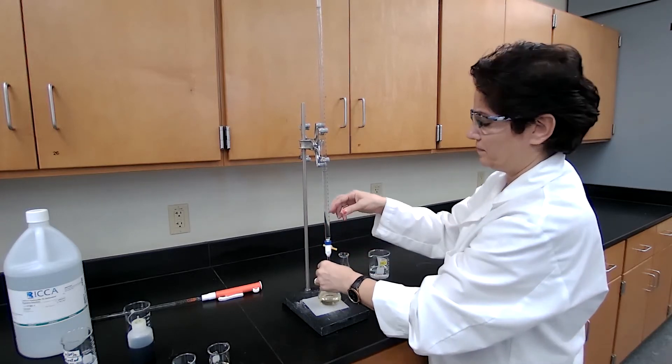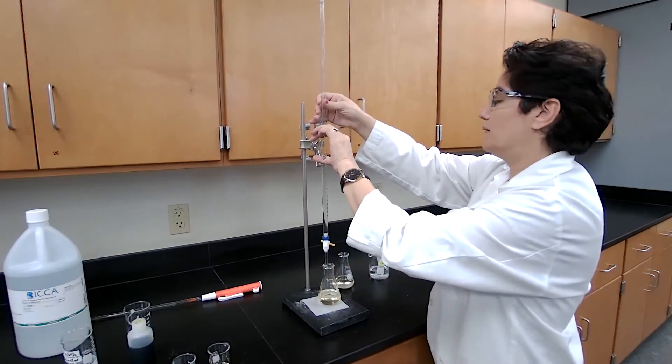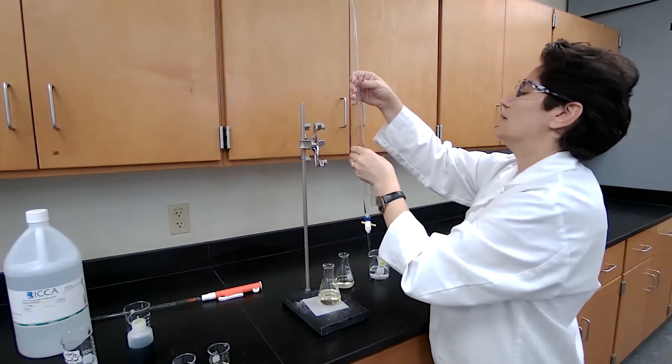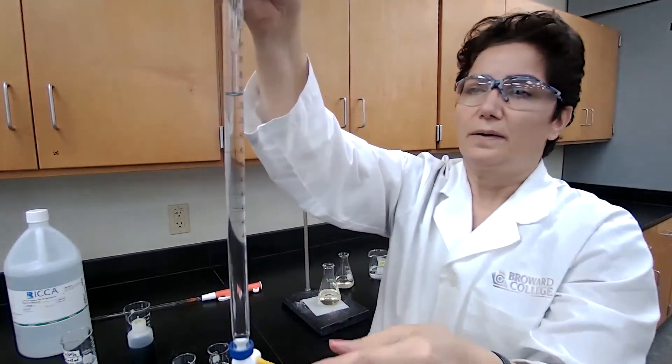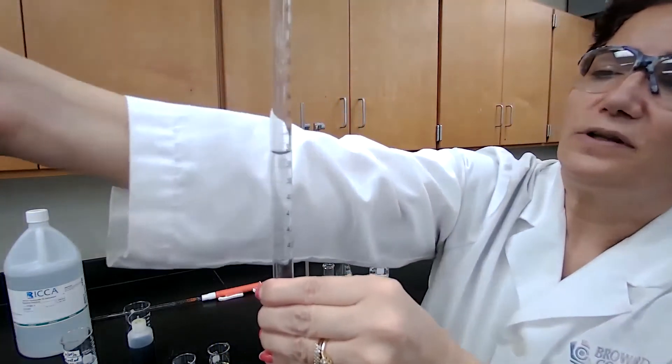Just adding one drop at the time now for the color change. Perfect.